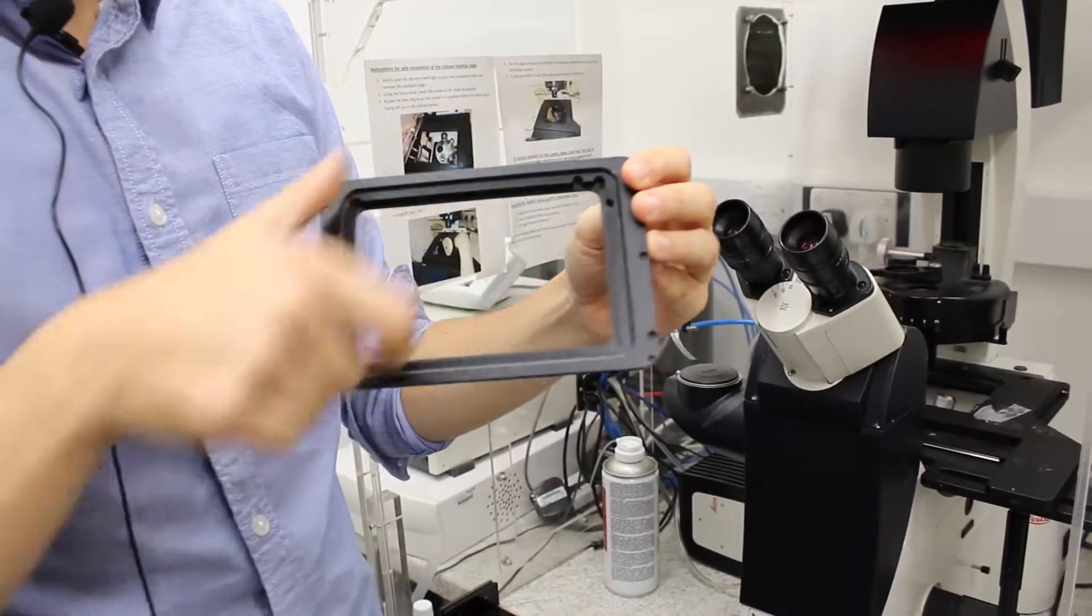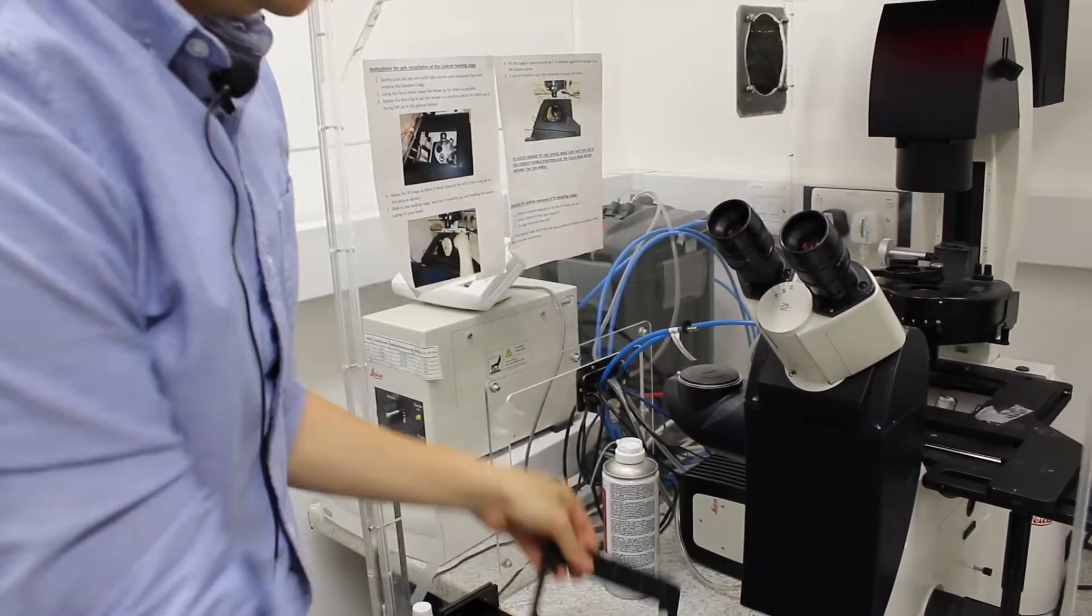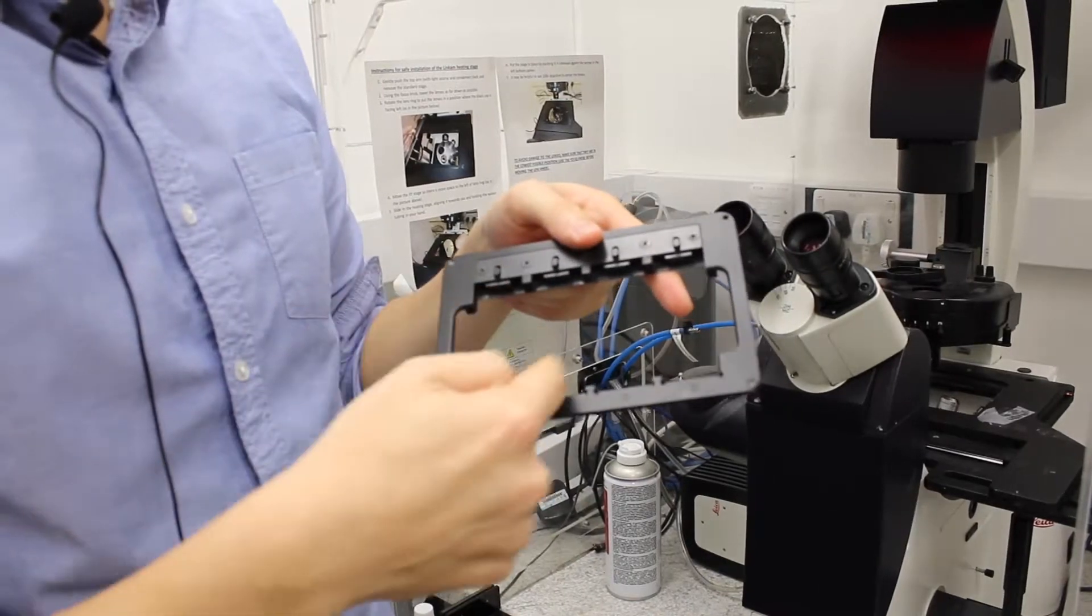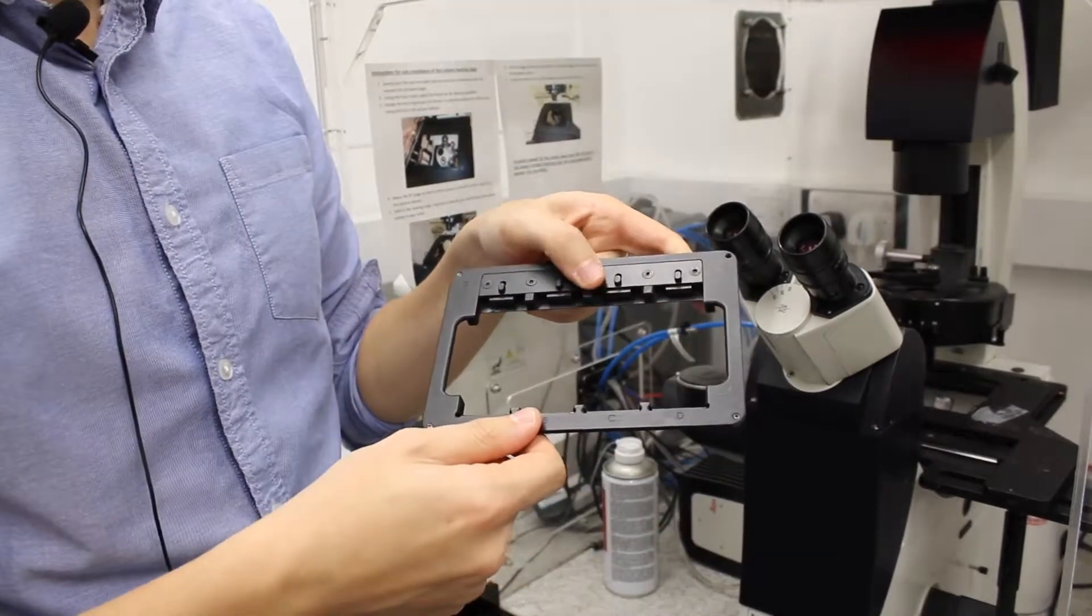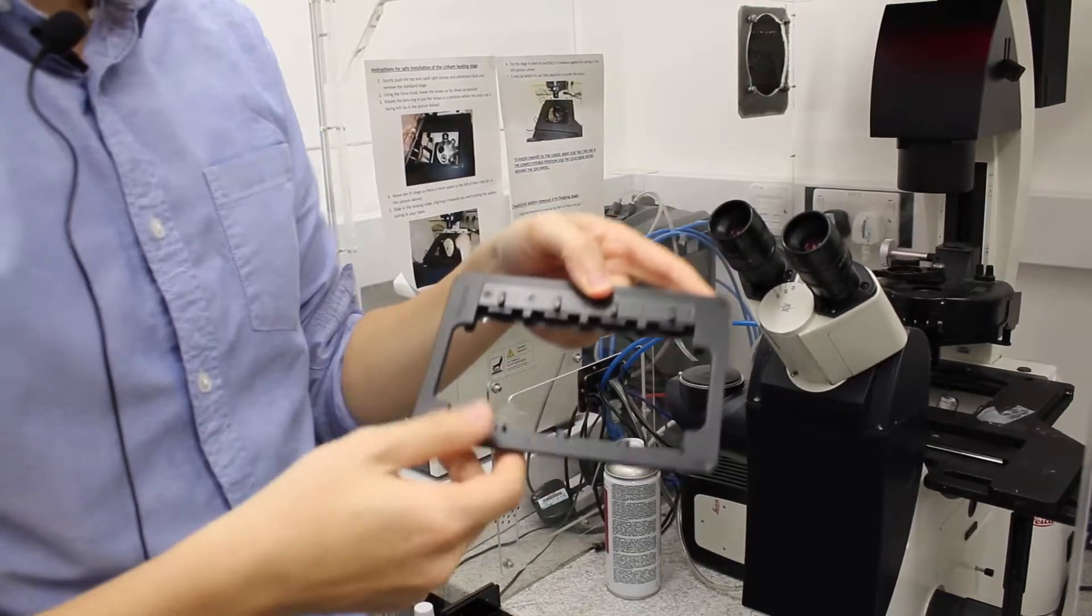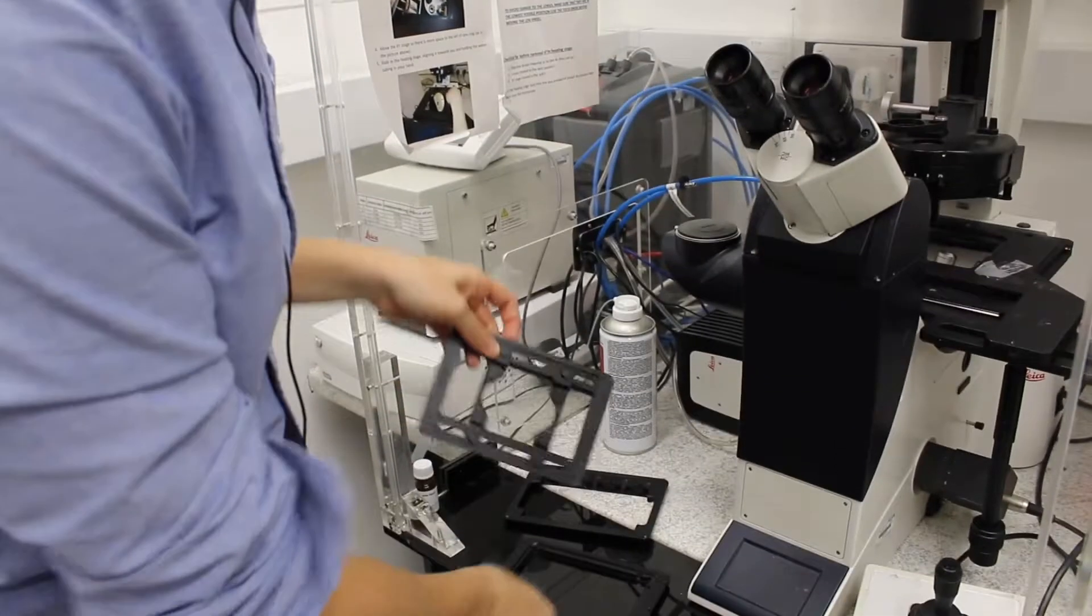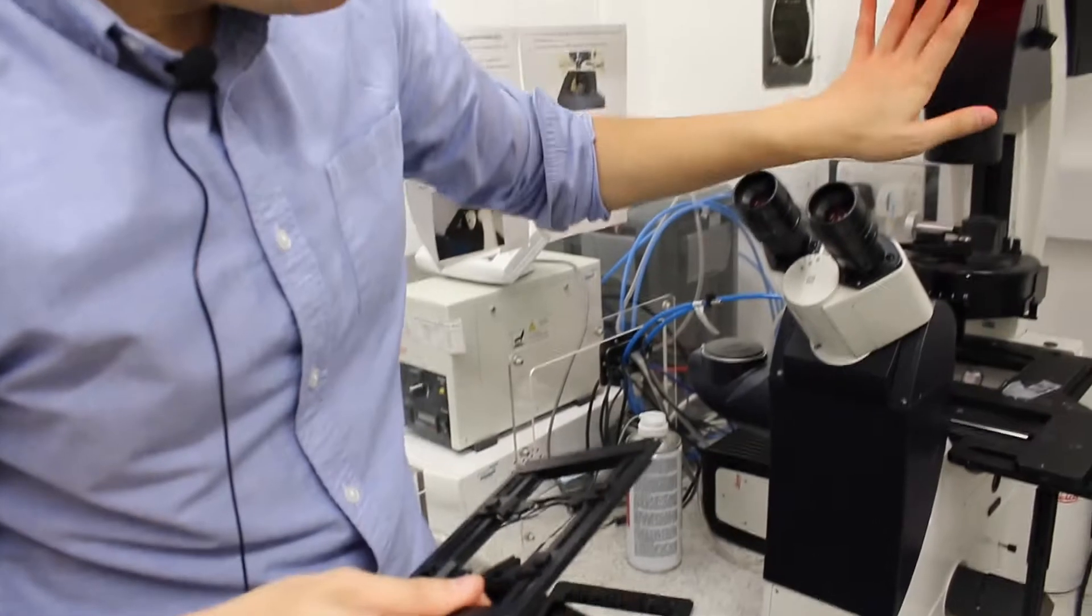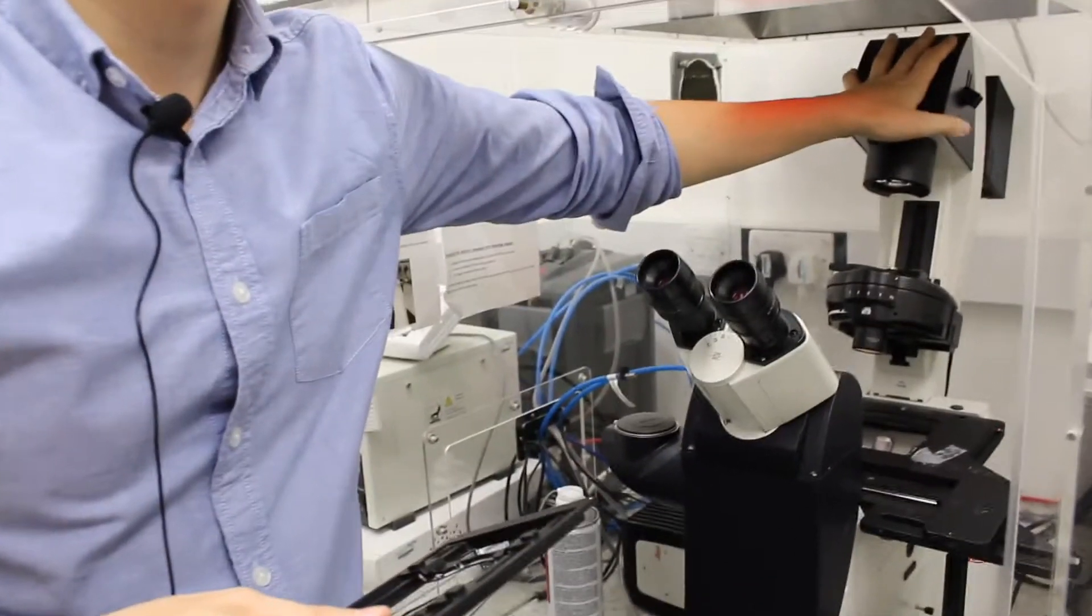And one is to put four different slides on the same, if you have multiple samples that you want to see. To put them, you can push the arm back, backwards. It will stay in place, just don't push it too strongly so that you're not breaking it.